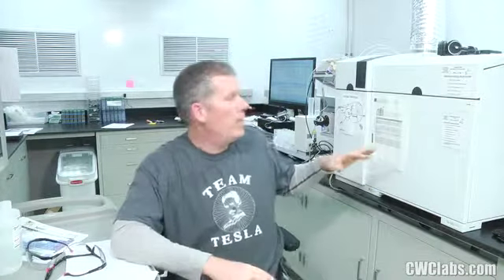And if you, wow, there's thunder out there. Anyway, if you combine that with the warm-up time of the instrument and having good pipetting technique for your external standards that you put on your autosampler, then you're going to have a very clean run. Even if it's a very long duration run, you're going to be in great shape.